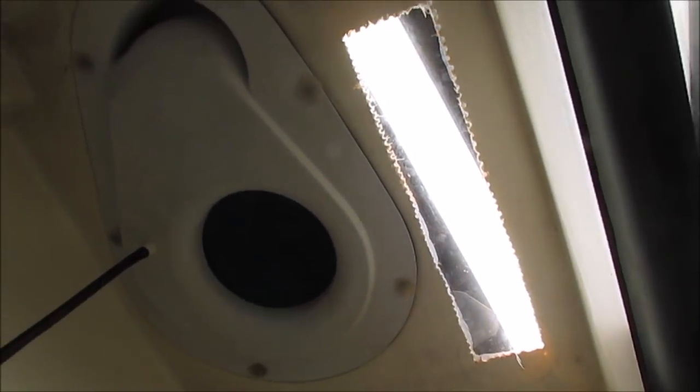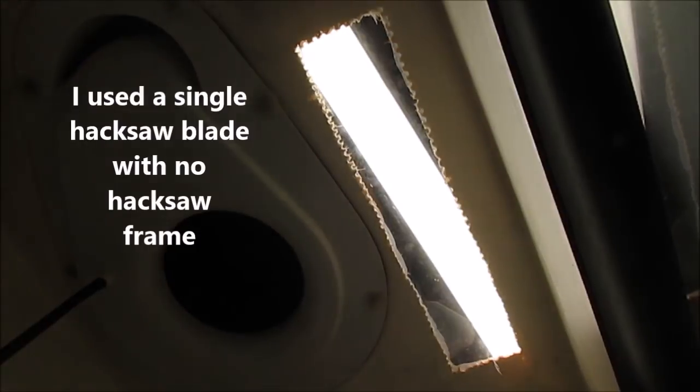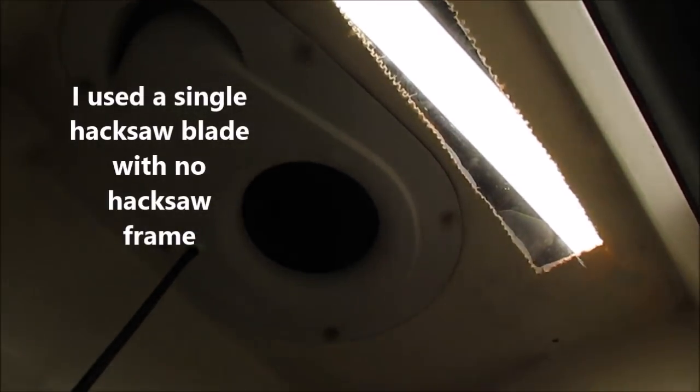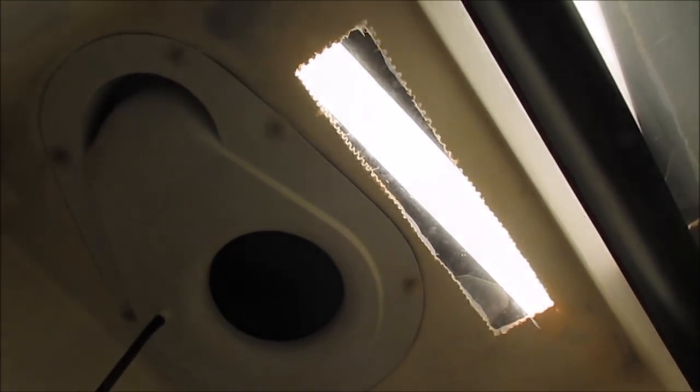It's inside. And as you can see up there, I went ahead and cut some rough holes in the fiberglass. And then I took a saw and sawed a chunk of the fiberglass out. And then I glued a piece of plexiglass up there. And then I wired in an LED strip so that I have plenty of light in my Fume hood.